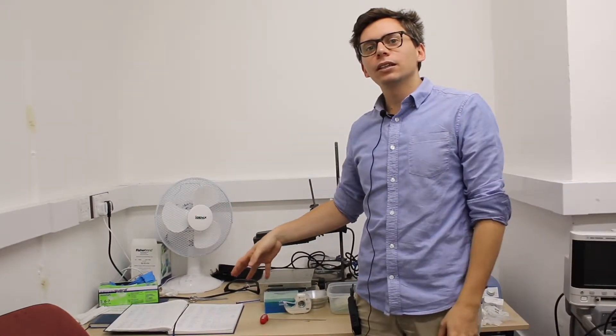So do log in the logbook every time you use the microscope, so we know what people have been using. If there is a problem, for example, spillage on the objective, we know how to clean them. So just a general message. You're dealing with optics, so of course you shouldn't put your fingers or anything else on the eyepiece or on the objective.